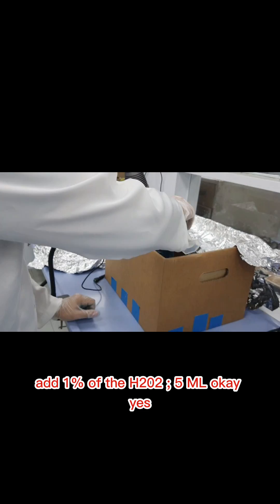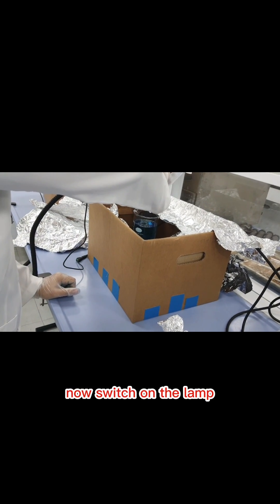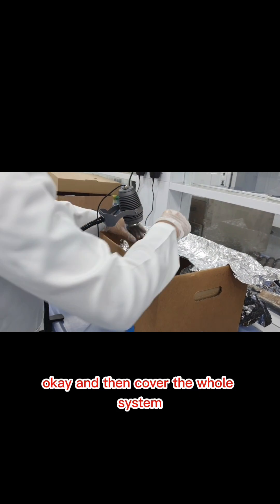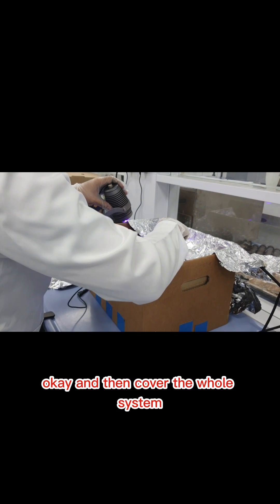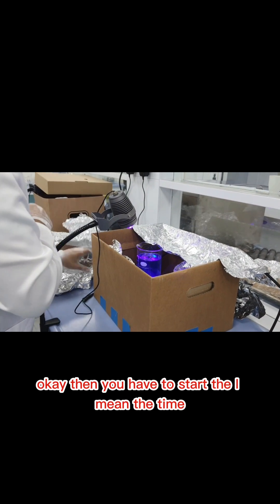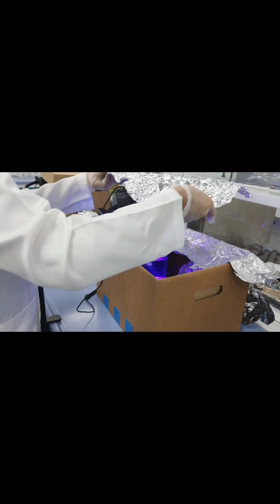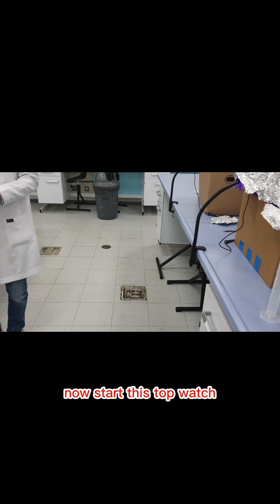Now switch on the lamp and make it focus, then cover the whole system. Then you have to start the time. Now start the stopwatch, note down the time for kinetics.